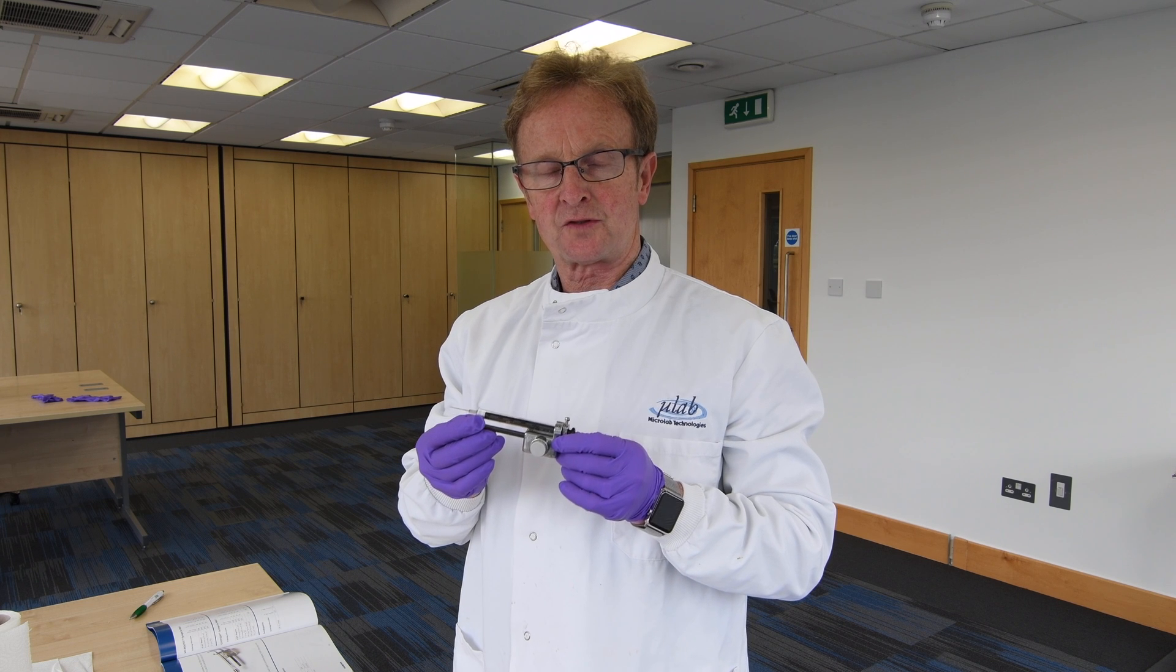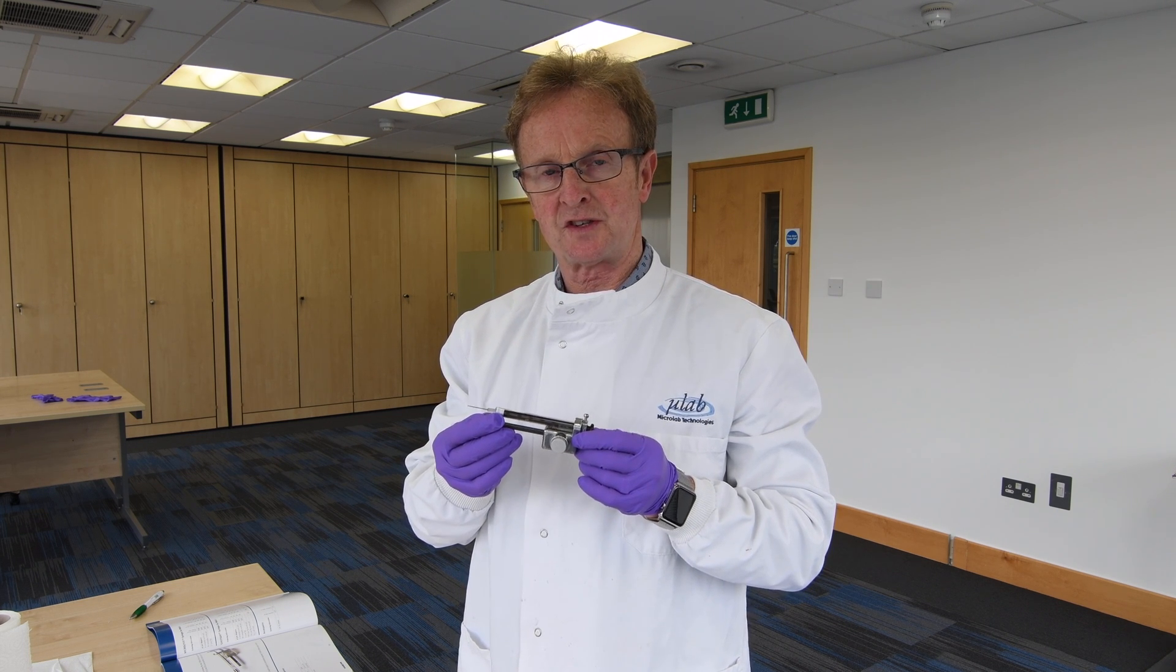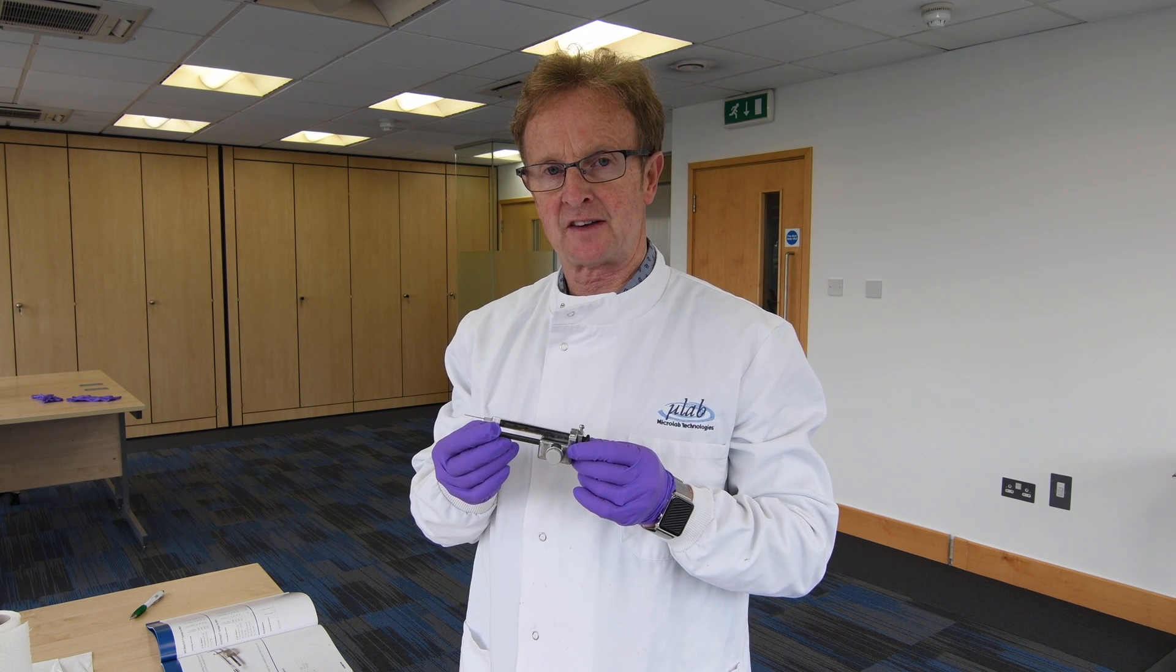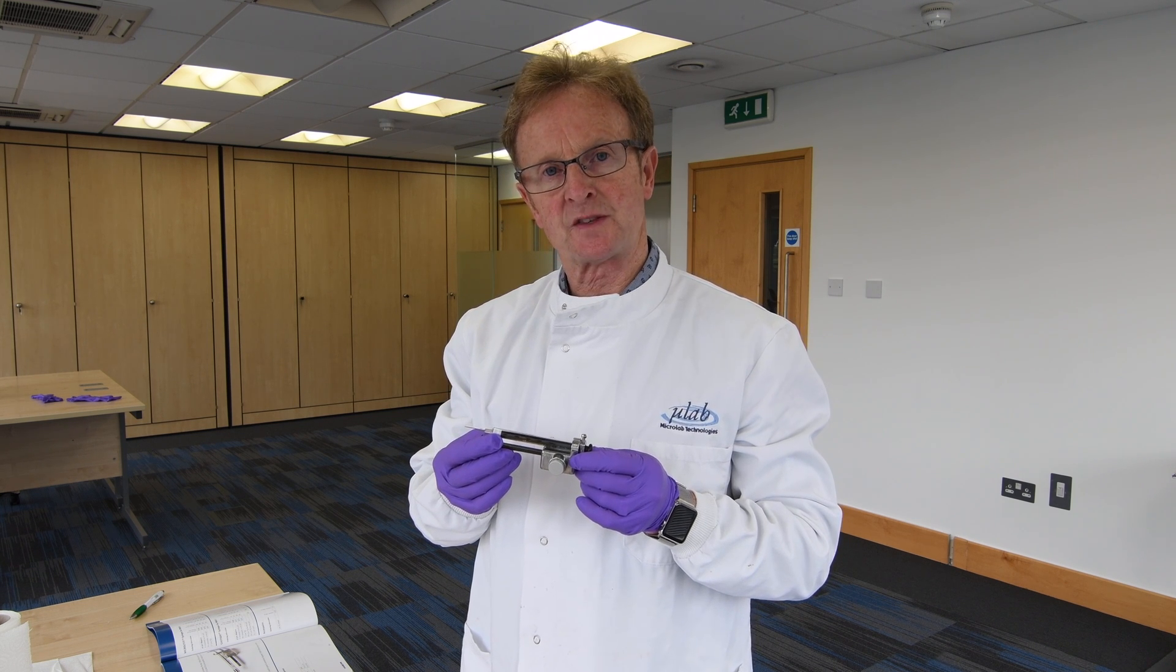I'm going to show you how to assemble the device, which can be used in conjunction with a series of syringes and needle formats to allow you to dispense solvents and standards precisely by methods of positive displacement.